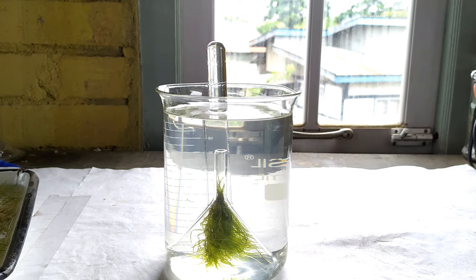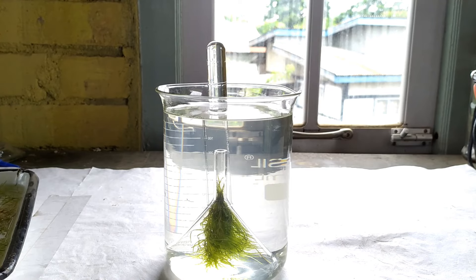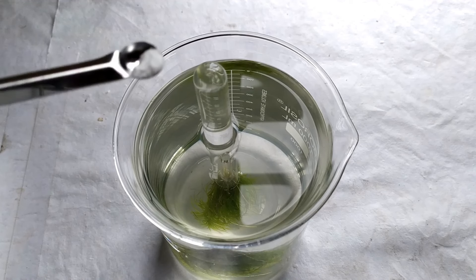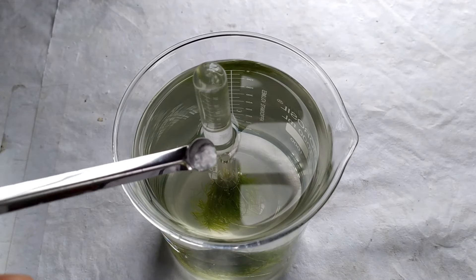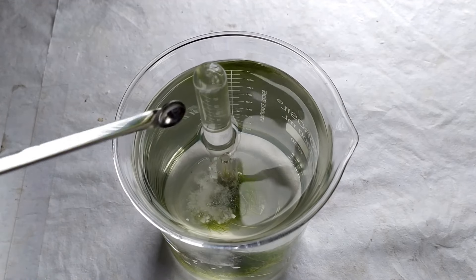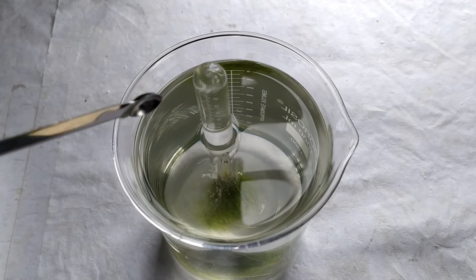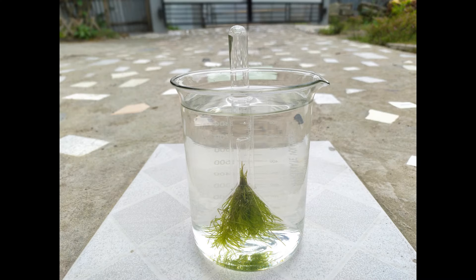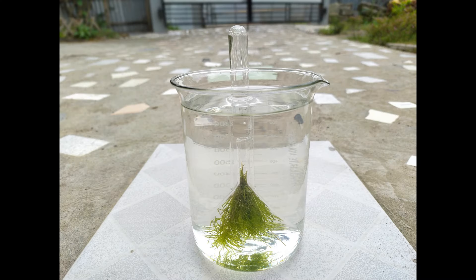The setup is now complete. You may also add a pinch of sodium or potassium bicarbonate into the beaker to kick-start the photosynthesis process. Place the setup in sunlight.